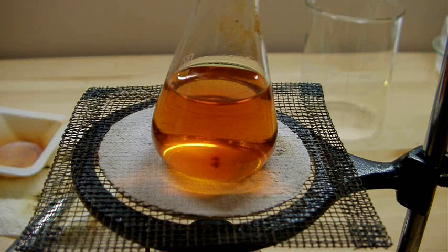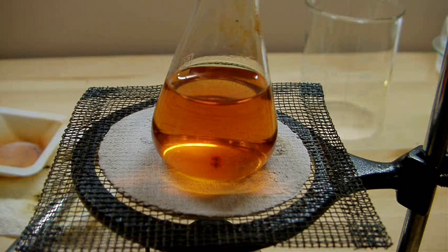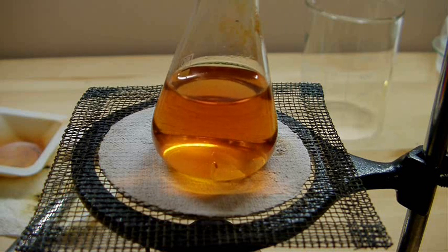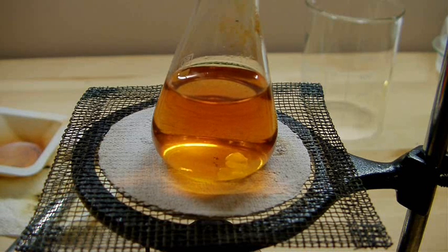I dissolved all of the iodine and as you can see, I went a little bit too far and added too much iodine. So the solution is very colored, it's full of iodine. That's easy enough to fix by just adding a bit more potassium hydroxide, a few more flakes of that.